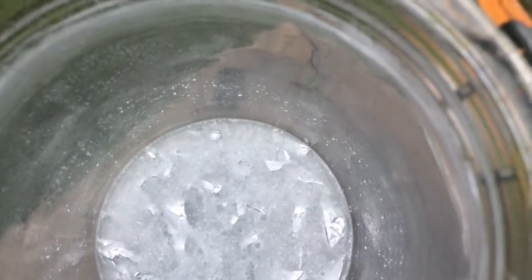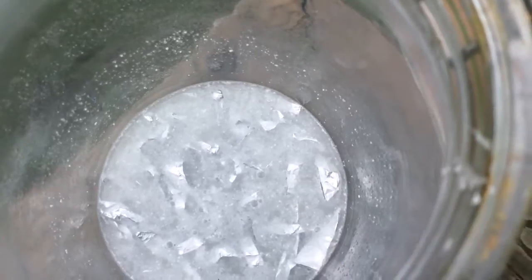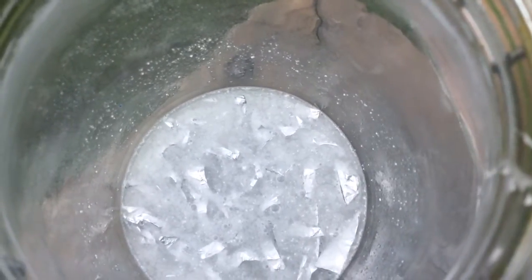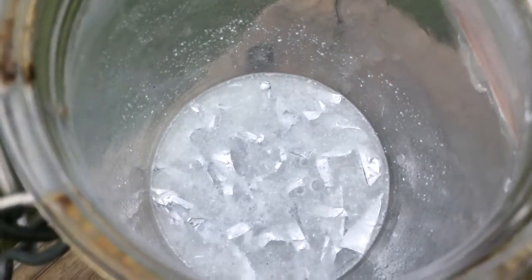Now you can hear and you can see bubbles. Soon you really start to get a fizzing sound. Now I used warm water and this helps accelerate the experiment somewhat. So what we're going to do is we're just going to keep watching.